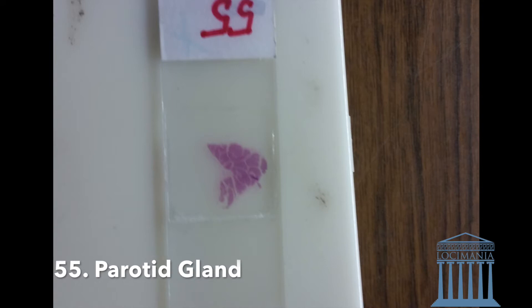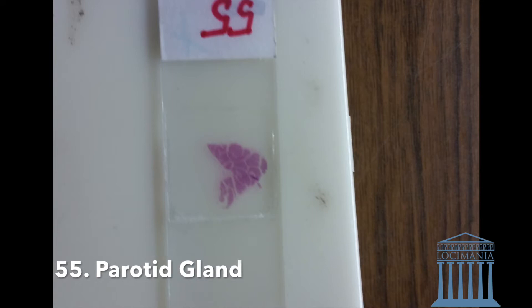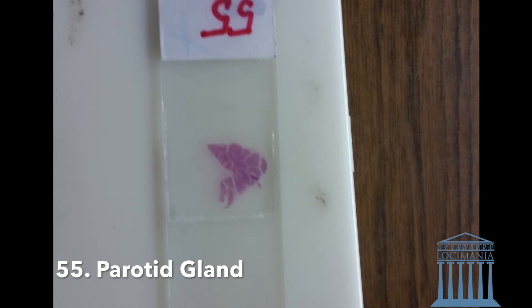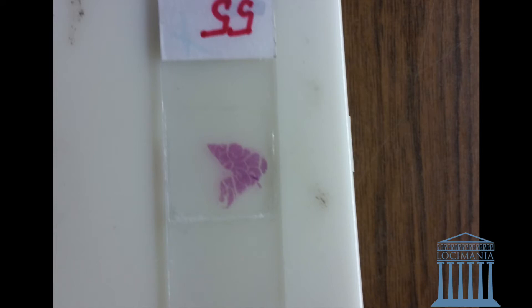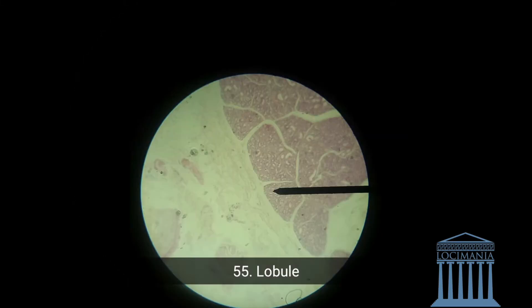Here's how the parotid gland looks outside of the microscope. Continuing onwards, we have the lobules. First we have one lobule, and that's the second lobule.